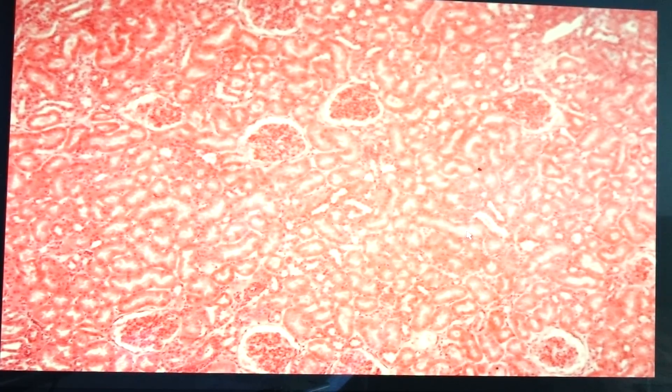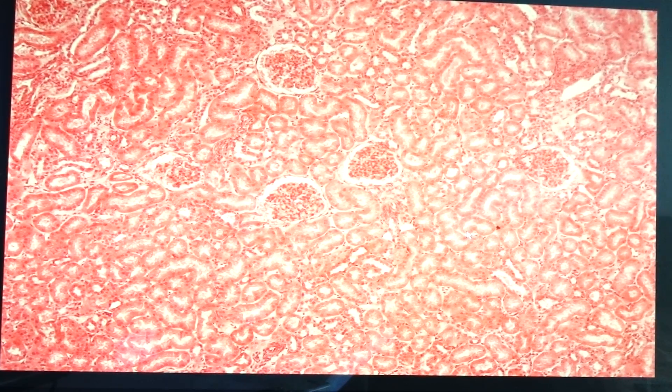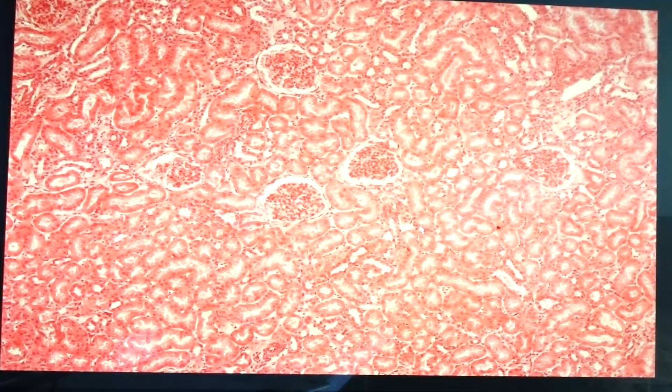So now we talk about the nephron. A nephron is the functional, structural, and fundamental unit of the kidney. It is composed of the glomerulus as well as the tubular system. Sometimes in the cortex you would see these vertical striations, and these are what we call medullary rays. They would emanate from the medulla.